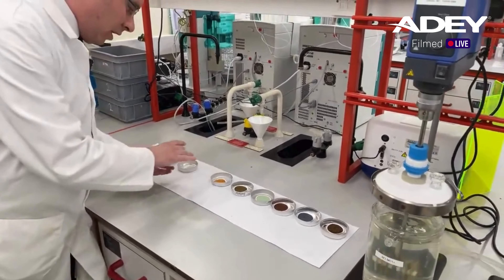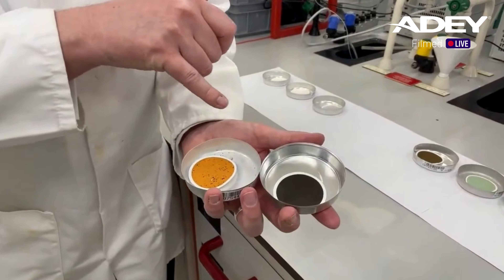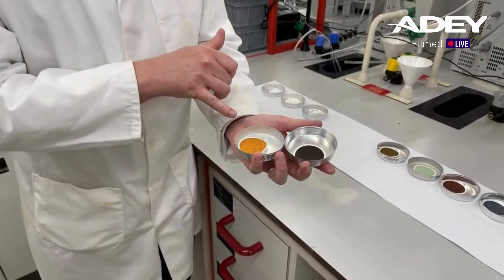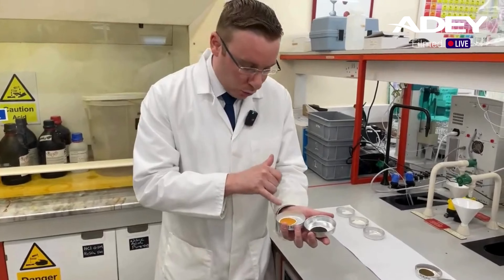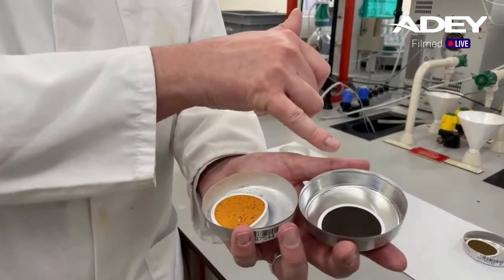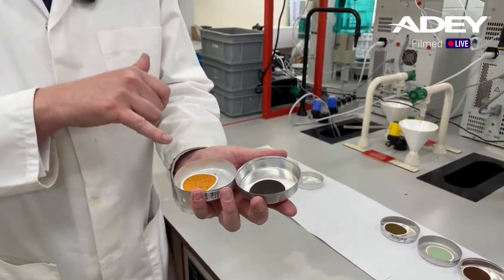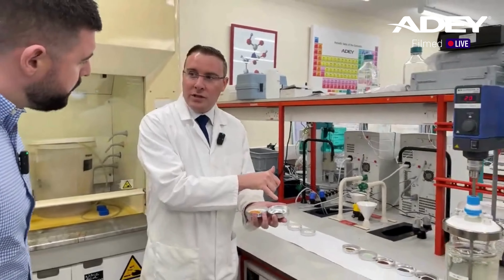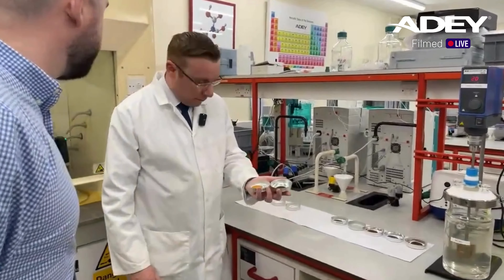For example, both of these papers here were from samples that contained quite a lot of iron corrosion, as you can see. However, one is black and one is orange, yet they've both got iron corrosion. This system, along with having iron corrosion, was also suffering from a lot of air ingress problems - a lot of fresh water has been added. And this one is a sealed system. Because when left to its own devices, the iron corrosion will preferentially be in this state, which is the Fe2O3, as opposed to the Fe3O4, which is the characteristic magnetite. Because that's what you see on a magnet clean and what's captured on the magnet.